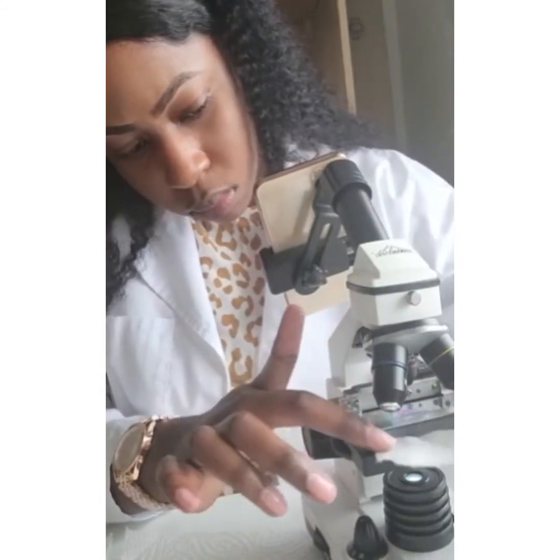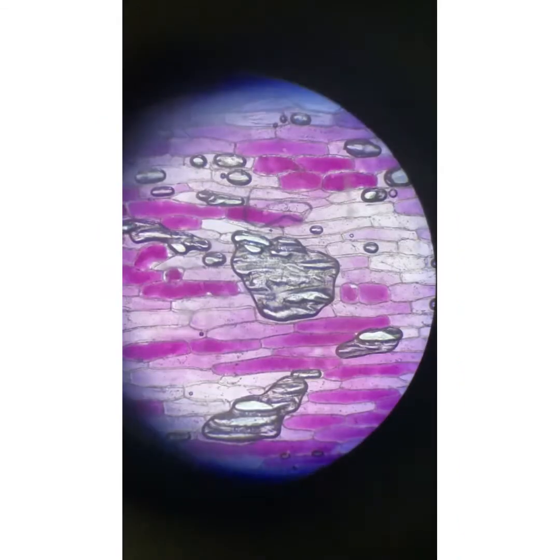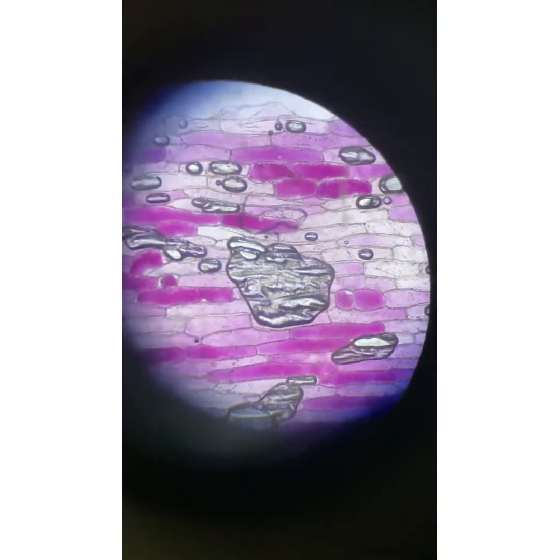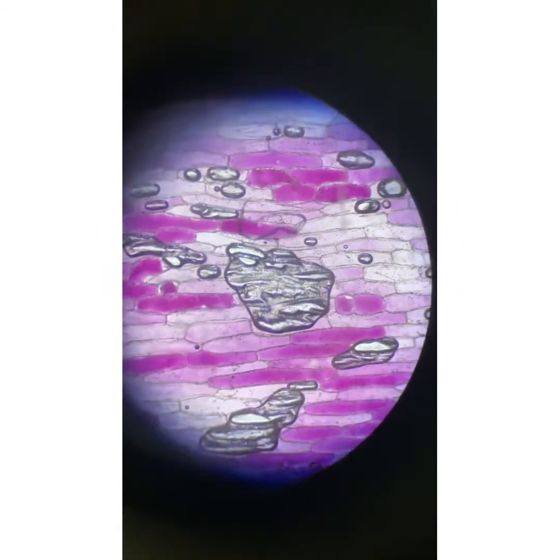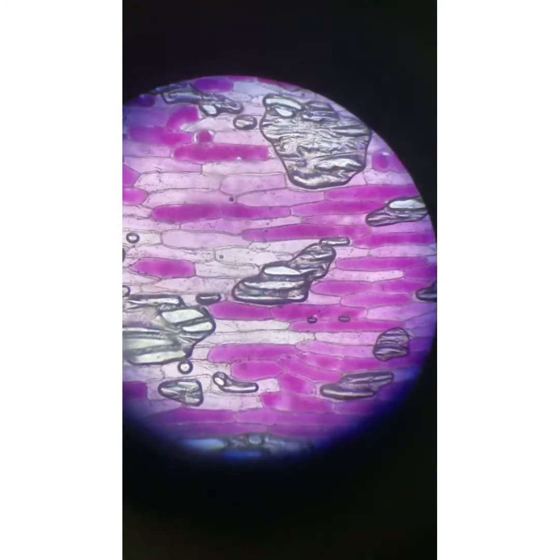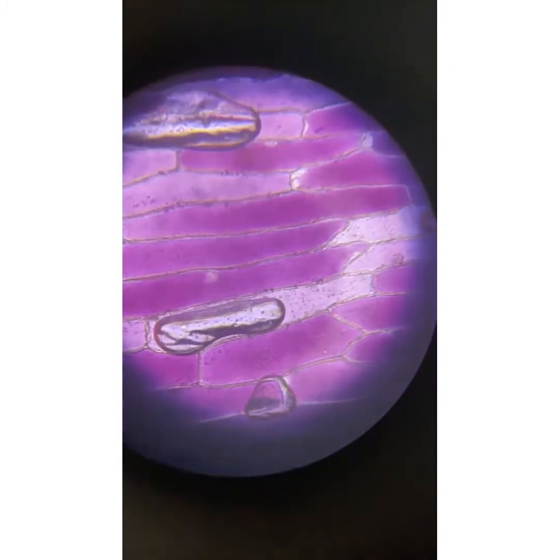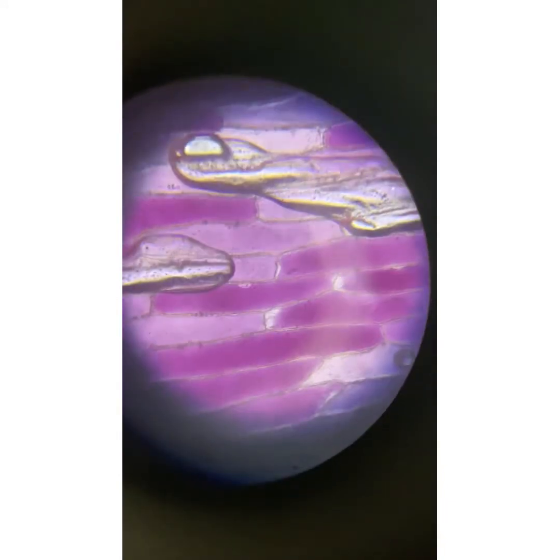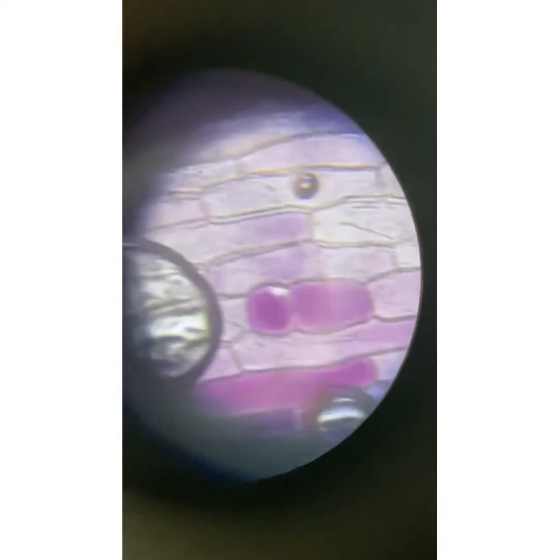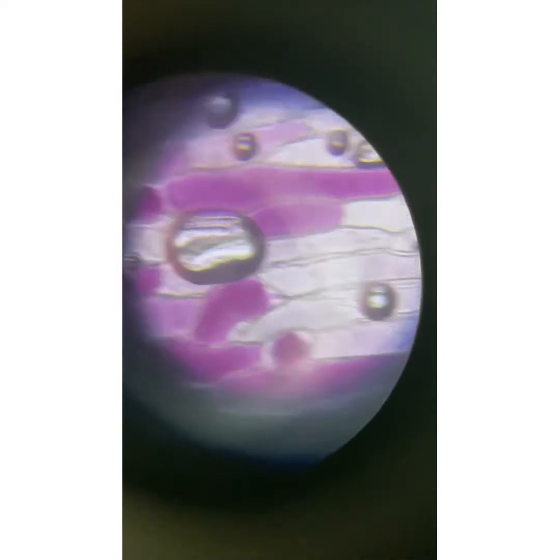And I'm excited! When I first showed you the normal onion cells, they were a bit fuller, with a distinct purple area. Now, when the cell is plasmolysed, you can see it is less turgid — it's shrunken.